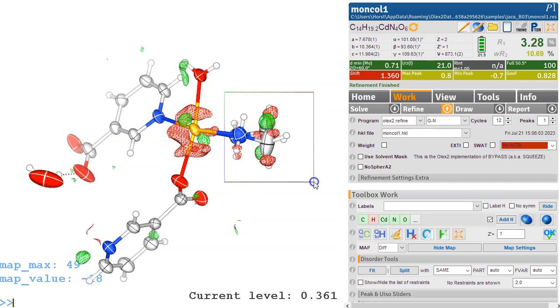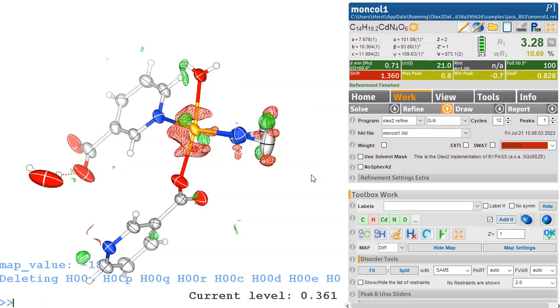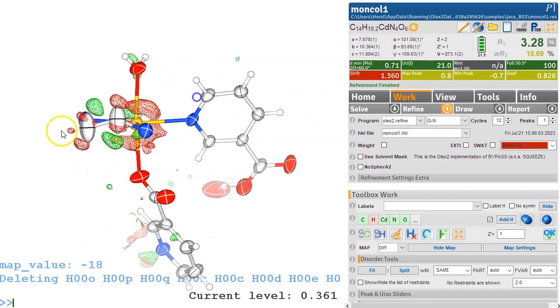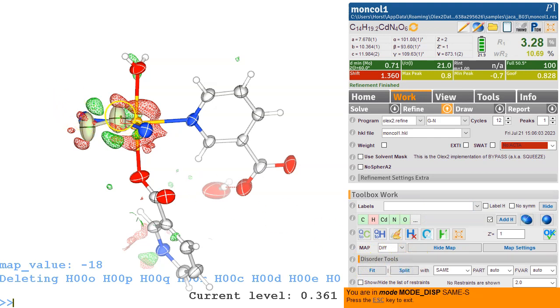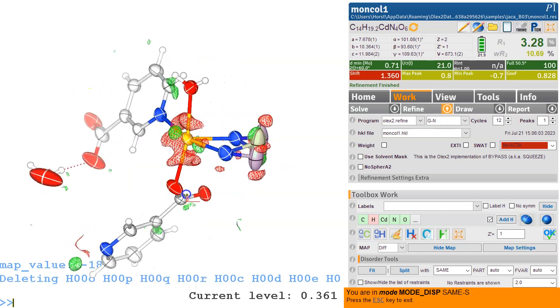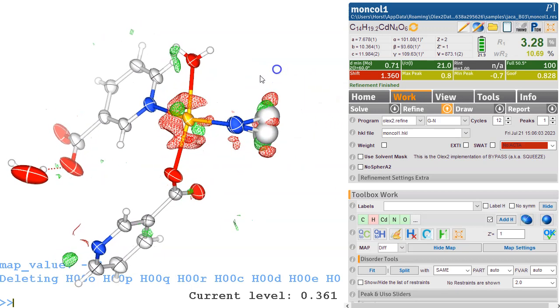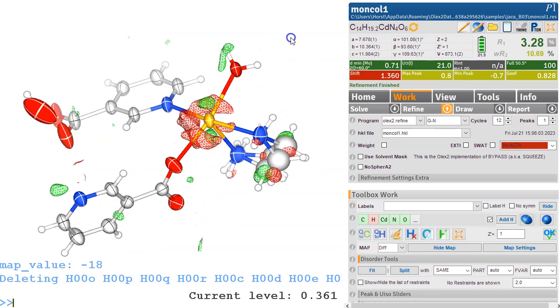So what I'm doing is, first of all, kill $H, get rid of the hydrogens if you're doing the disorder modeling. And then what we want is this turned over upside down. So I'm selecting both of those, and in toolbox work mode, disorder tools split. And all I'm doing is I selected those two and then I'm moving them. That's it. So I want one up there and one down there, just with the greenness in the map. And we're done. So this was that.